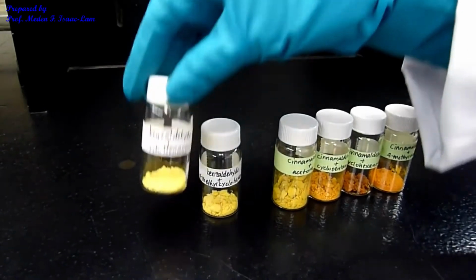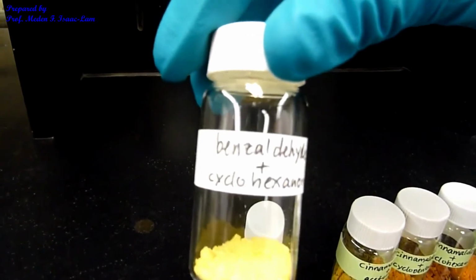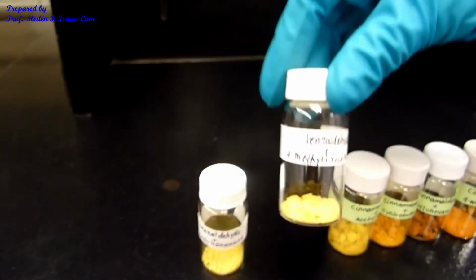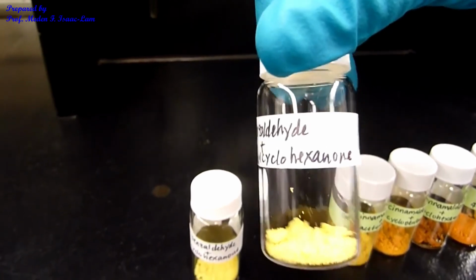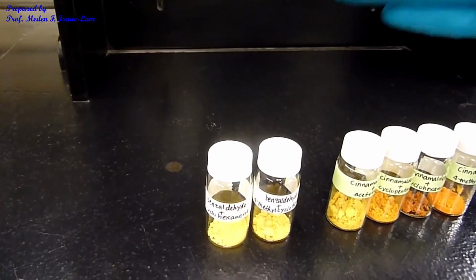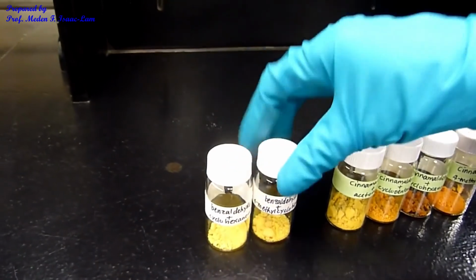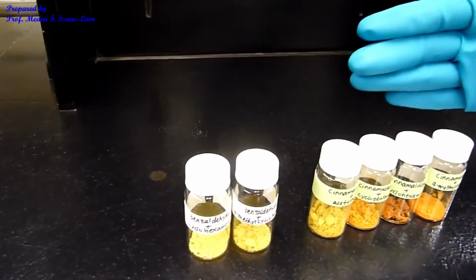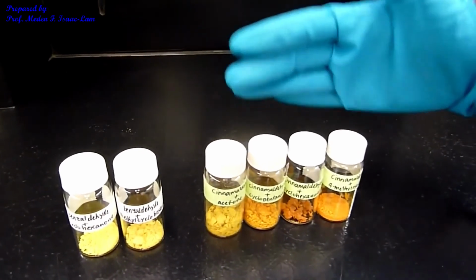So for example, this is a combination of benzaldehyde and cyclohexanone. And then benzaldehyde and 4-methyl cyclohexanone. So the aldehyde in those two samples is benzaldehyde, while the ketone is different: it's cyclohexanone, and then the other one is 4-methyl cyclohexanone. The next 4 examples in here are all the same aldehyde, and that's cinnamaldehyde.